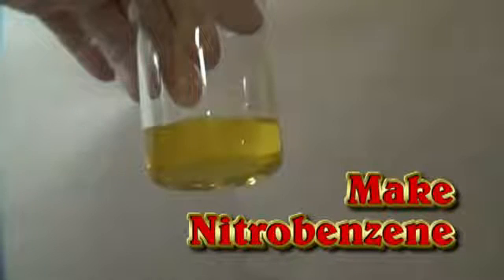Hello everyone. In this video we'll be making nitrobenzene, a useful starting point for chemical synthesis that we'll be using in a future video.